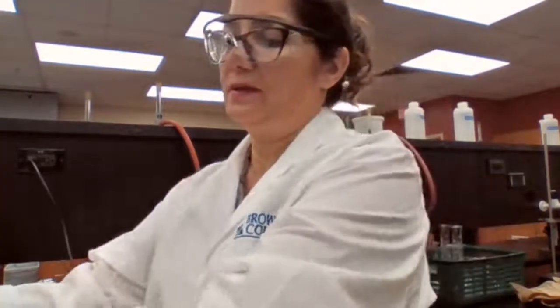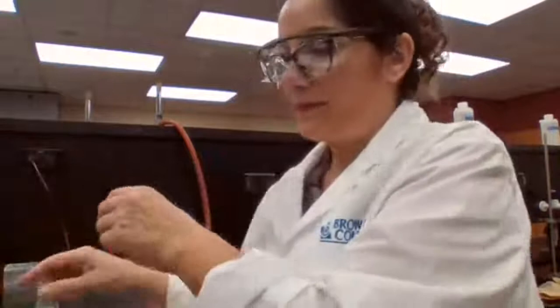We need to now, for the second trial, we just need 4 milliliter of the sample. So the mass for the empty flask is going to stay the same for the second trial.